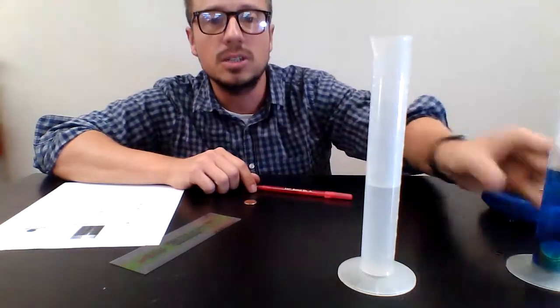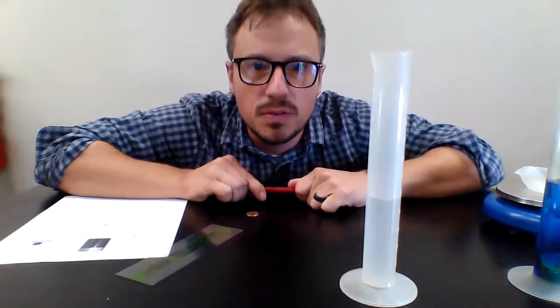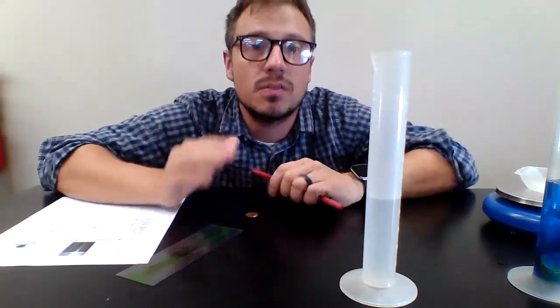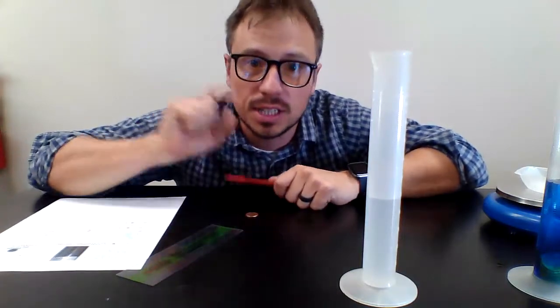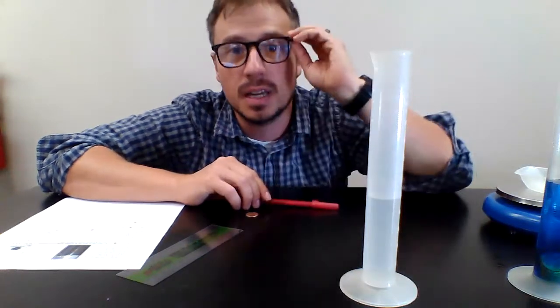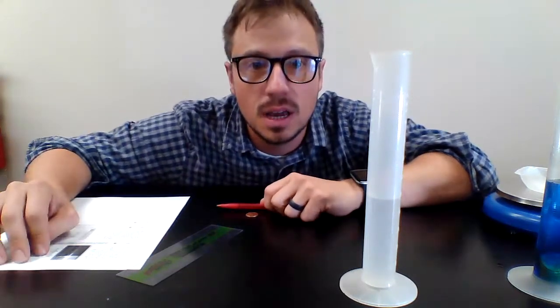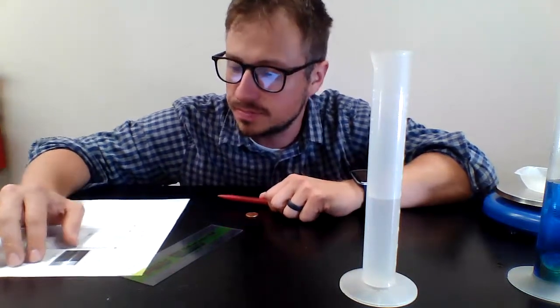Now, that one's kind of tricky because there's 20 pennies in there. I ask you to find the volume of a single penny. So whatever you got for the displacement, whatever you got for the volume of all 20 of those pennies, you're going to need to divide by 20 to find the volume of one single penny. Now, once you know the mass of one single penny and the volume of a single penny, then you can calculate the density. Now, there is a list of different metals that you can compare that density to find out what a penny is composed of.